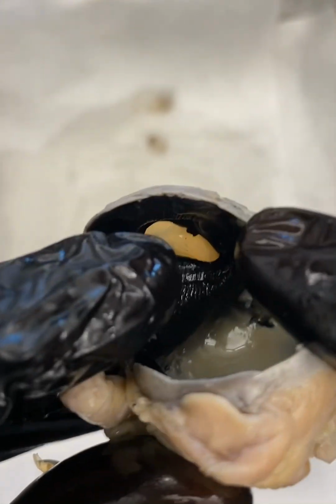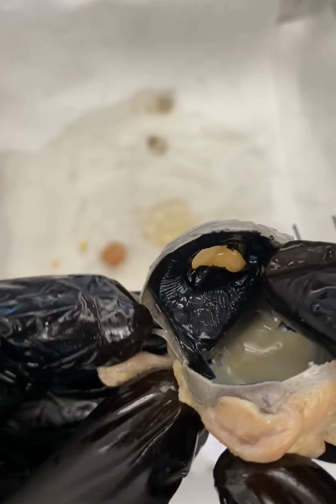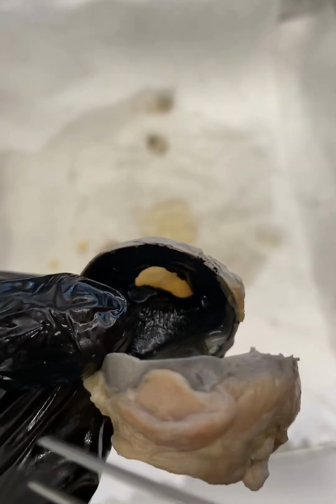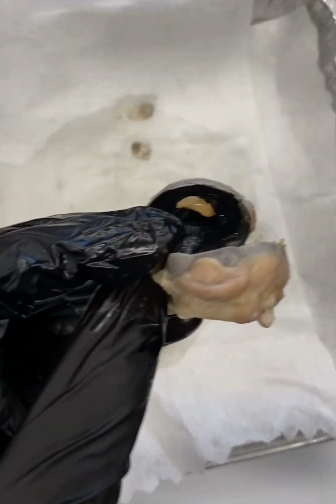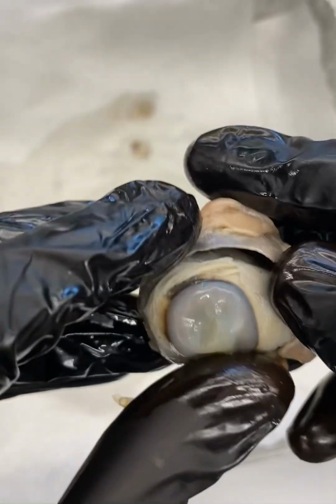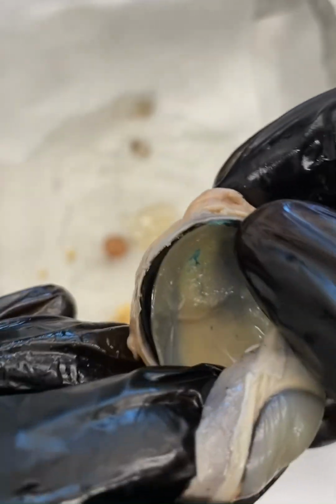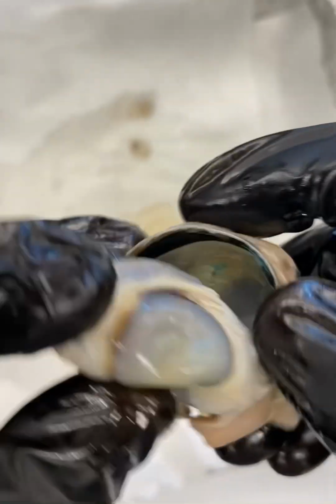And so as light is funneling in through that pupil, it is being bent, right? The light rays are being bent as they strike our lens, okay? And then those bent and converging light rays are going to be focused back here on our retina, right? On this yellow tissue all back in here, right?